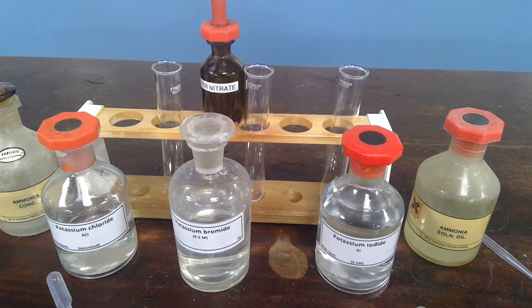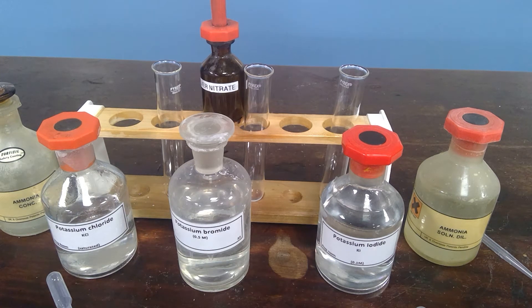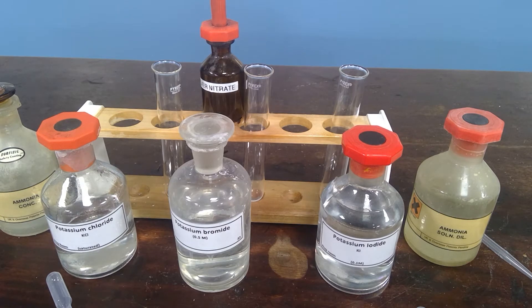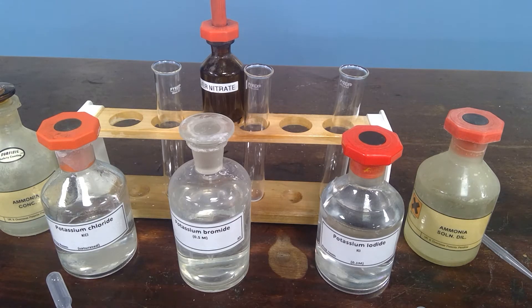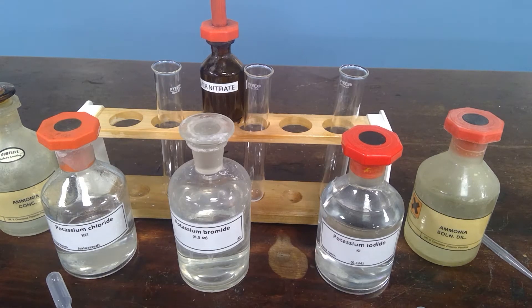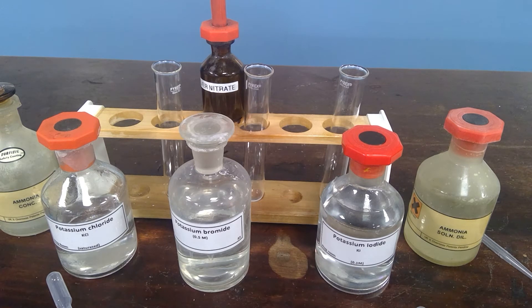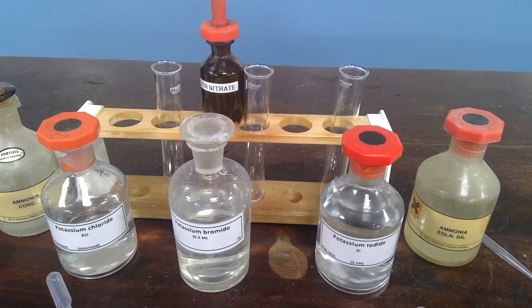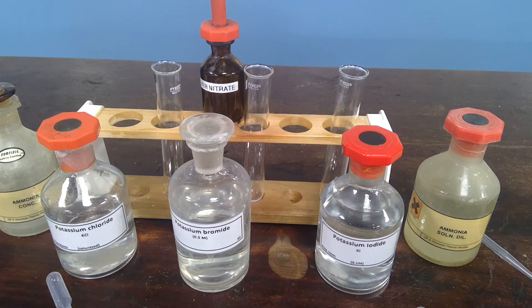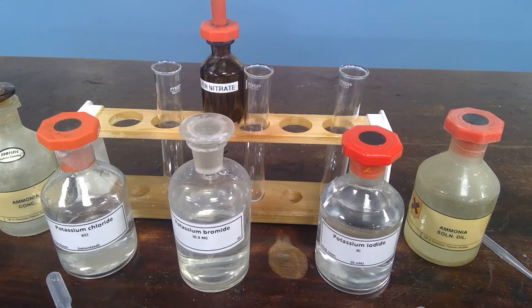This is an experiment to look at the reaction of aqueous halide ions with silver nitrate aqueous solution. This is a test that is often done at GCSE, but at A-level it takes on an extra part of the test.